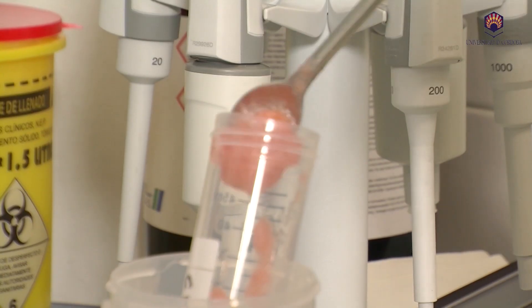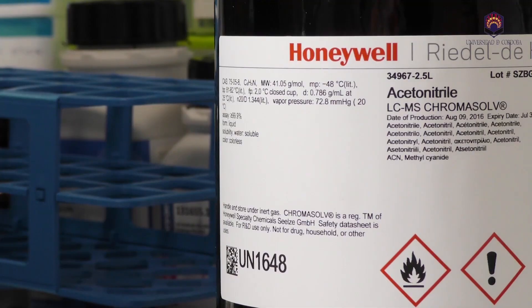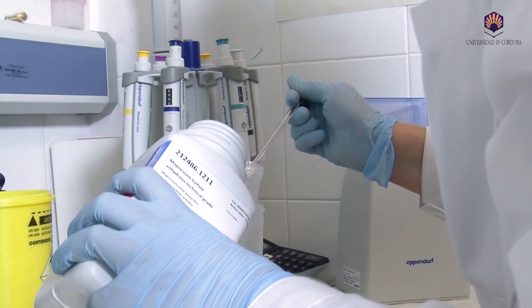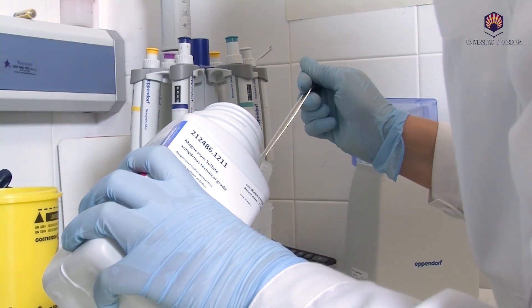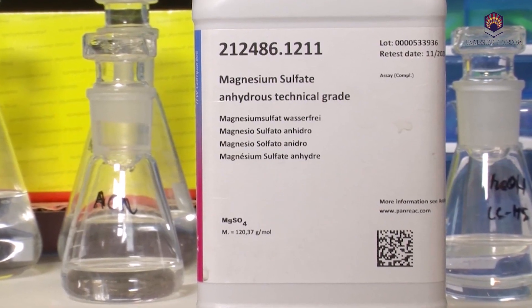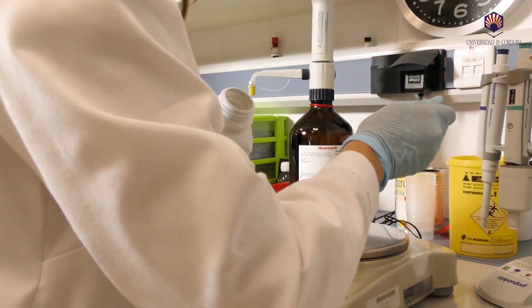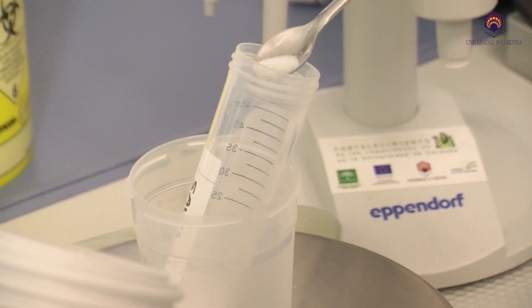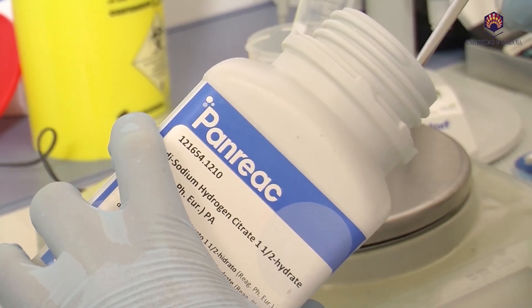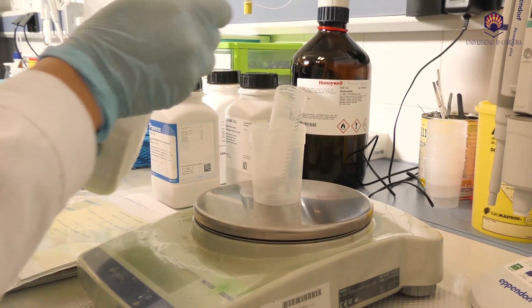First of all, in the extraction tube, we weigh 10 grams of sample and add the organic solvent — in this case, acetonitrile — and shake to allow for complete contact. The necessary salts are added in the extraction step of pesticides, such as magnesium sulfate, which improves the partition between the phases; sodium chloride, which controls the polarity enhancing the extraction of pesticides from the matrix to the organic phase; and citrate salts, which adjust the pH to 5.5 to extract all acidic and alkaline pesticides.